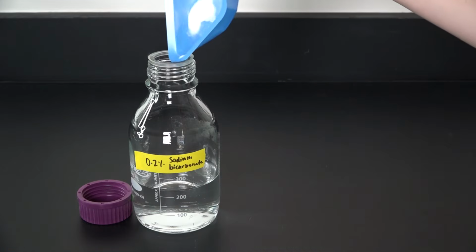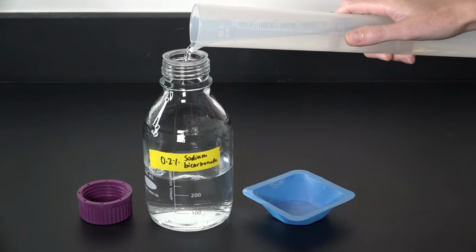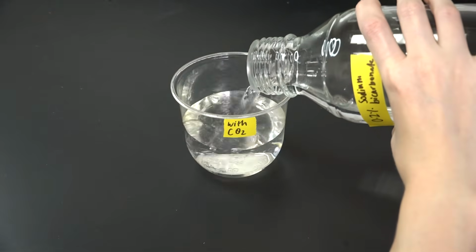First thing I need to do is prepare a 0.2% solution of sodium bicarbonate in water, so when it dissolves, there'll be plenty of carbon dioxide in there for our leaves to photosynthesize. I'm adding 0.6 grams of baking soda to this bottle of water and bringing it up to 300 mils. That solution goes into one of my cups, which I'll label with CO2.